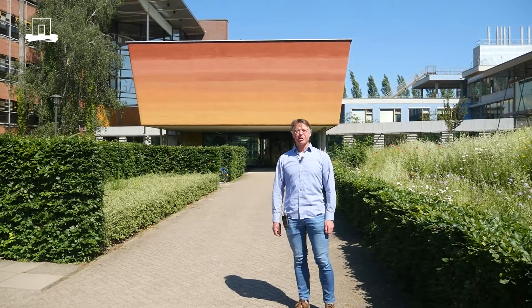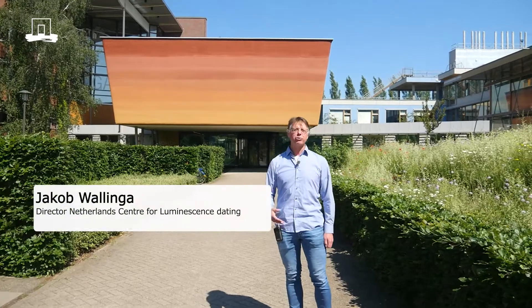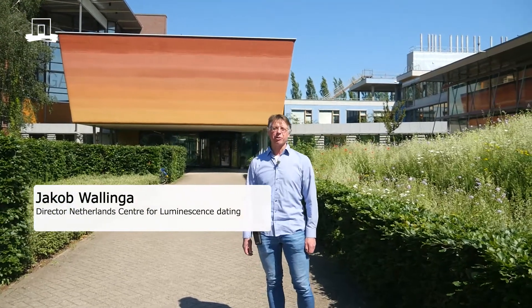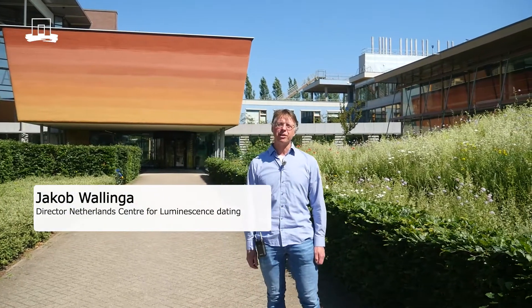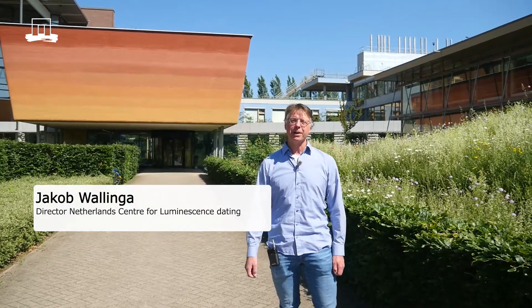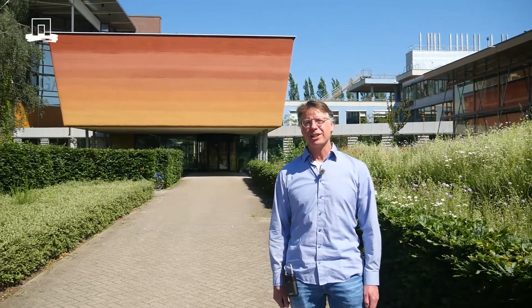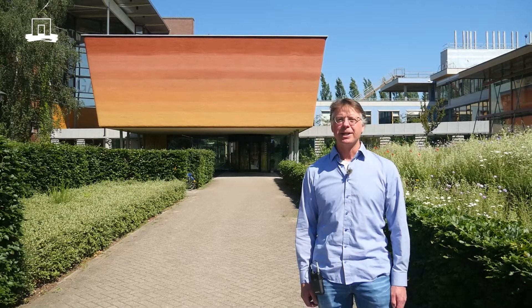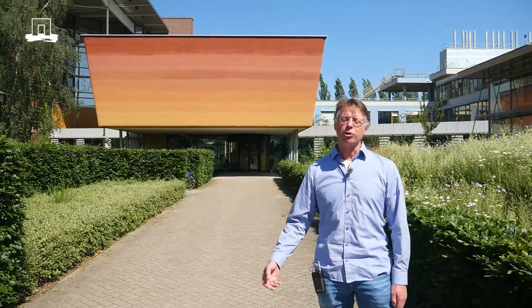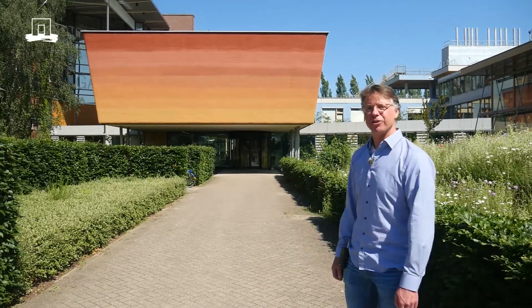Welcome to Wageningen University. Here in this building we host the Netherlands Center for Luminescence Dating. In this short video I will explain what Luminescence Dating is, show you the facility of the Luminescence Dating lab, and show you what we do there. Let me take you inside.